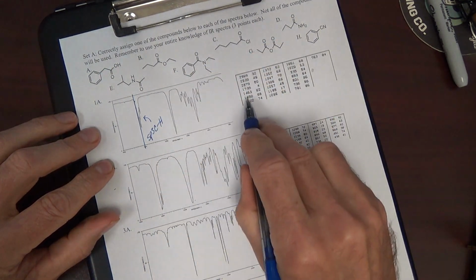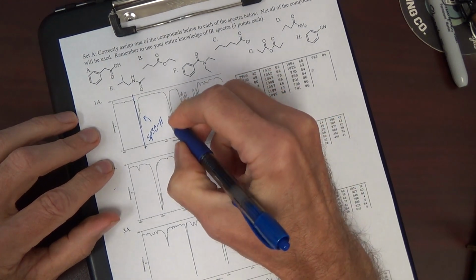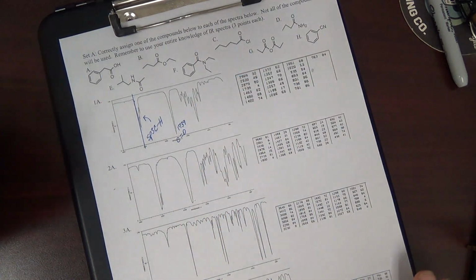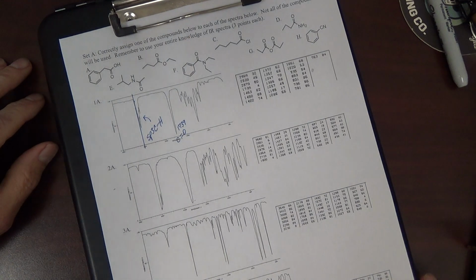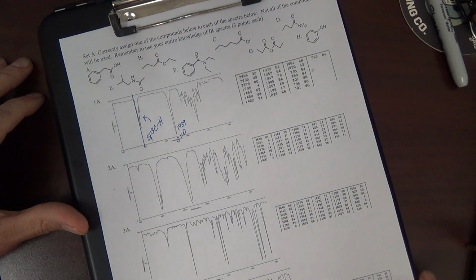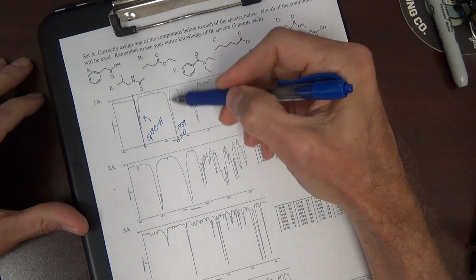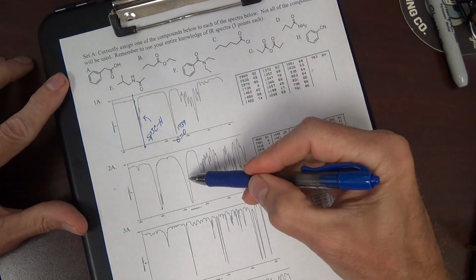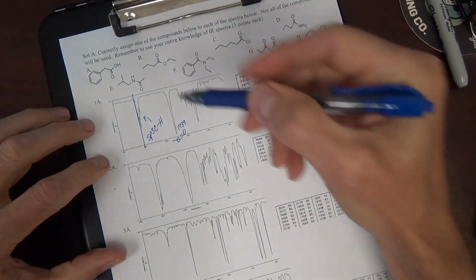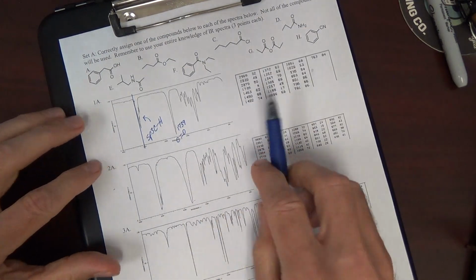So what is this peak at about 1739? We'll put that here. Well, that's classical carbonyl region. Carbonyl. Now, of course, lots of functional groups contain a carbonyl. Carbonyl tends to be one of the strongest peaks in an IR when it's present. For example, look down here. Okay, nice carbonyl peak. We'll get to that. The remainder is fingerprint, about 1,500 down, fingerprint.